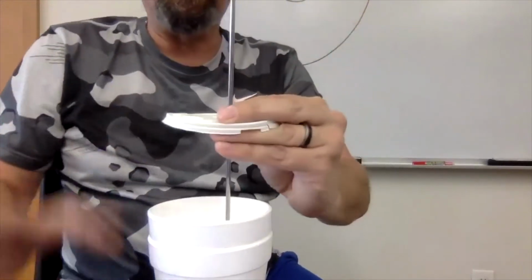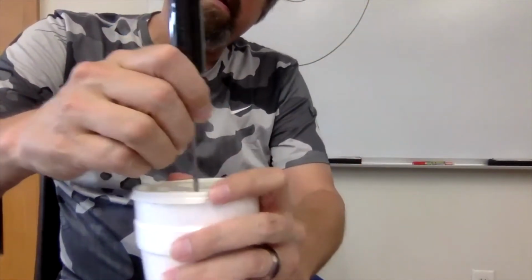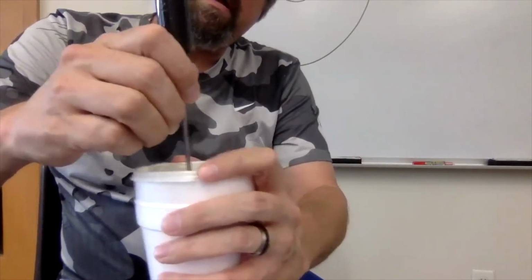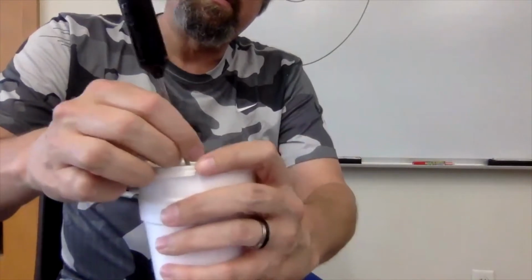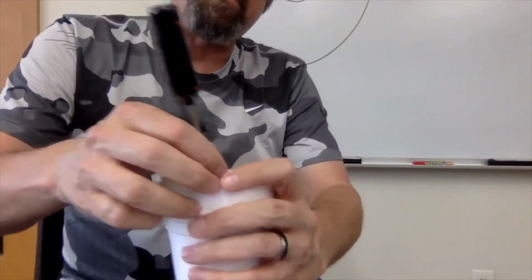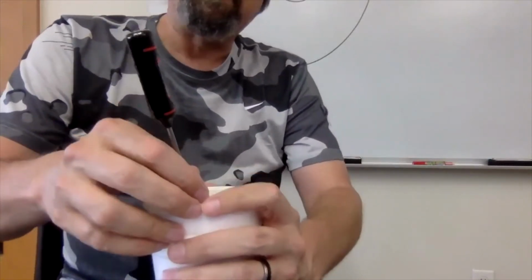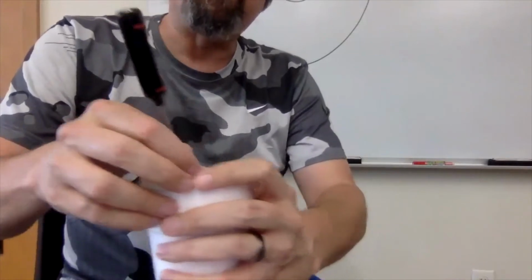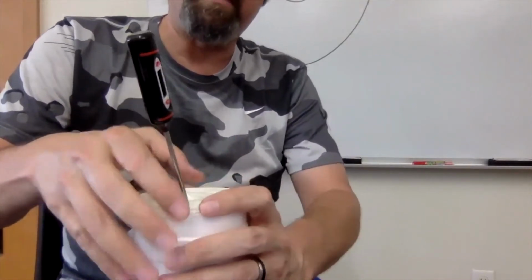And there it is. Okay. That's good to stir it. And I can stir with the thermometer is one way to do this. And I'm already beginning to see that there's a temperature rise. It's starting to go up. So think about what type of reaction this might be, whether it's endothermic or exothermic, based on the temperature going up.